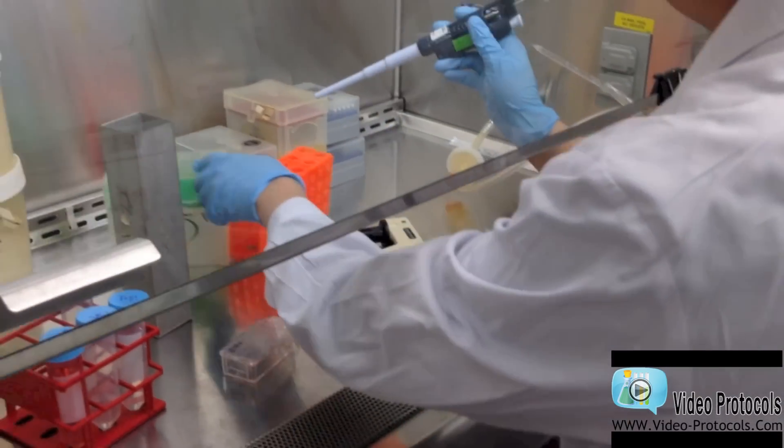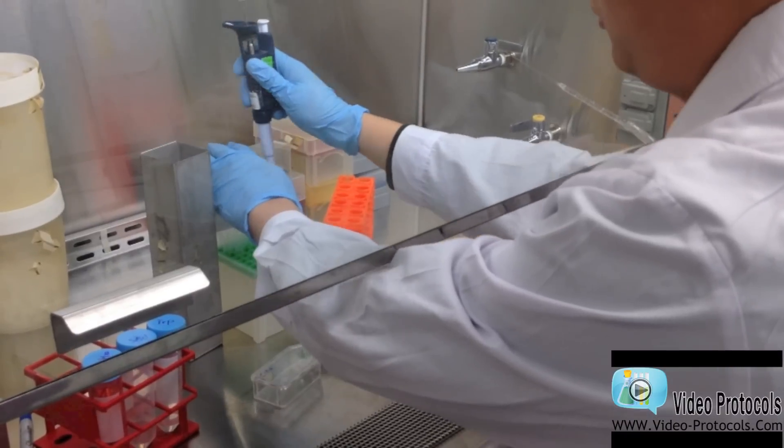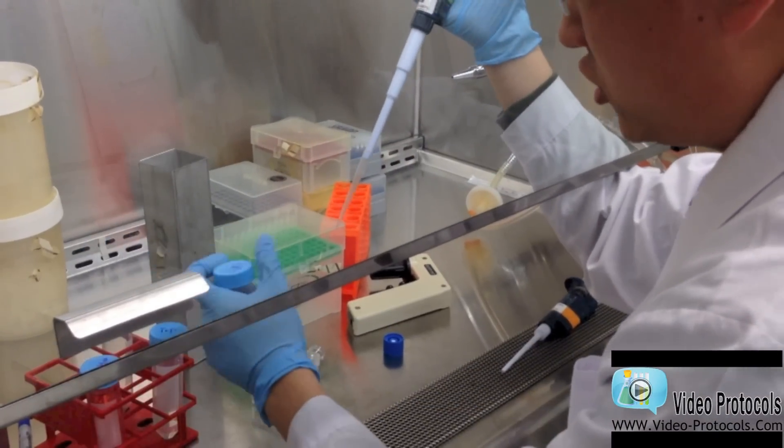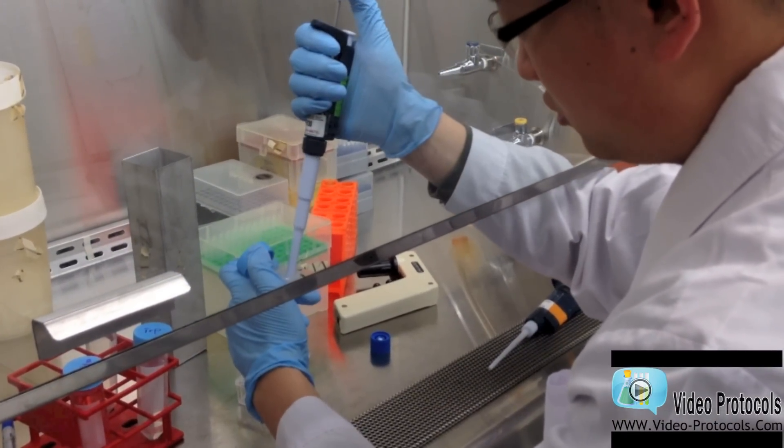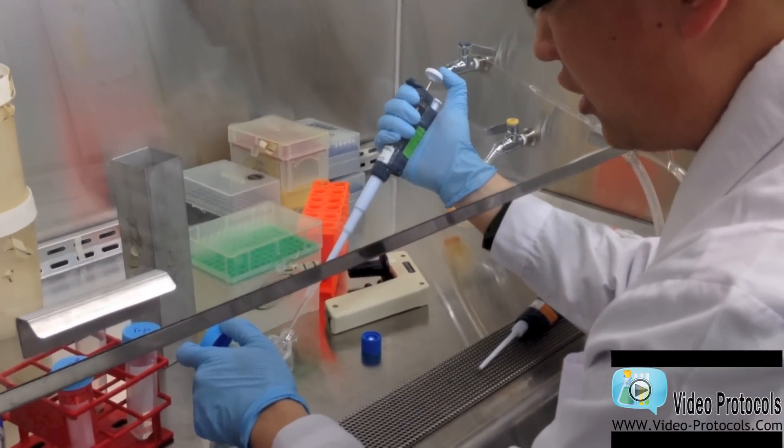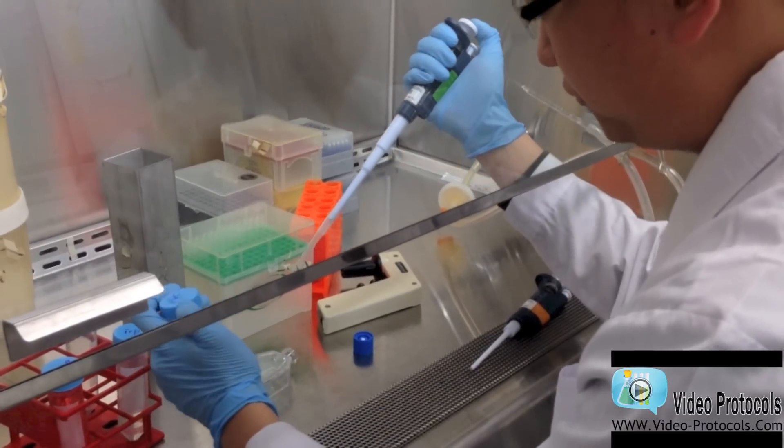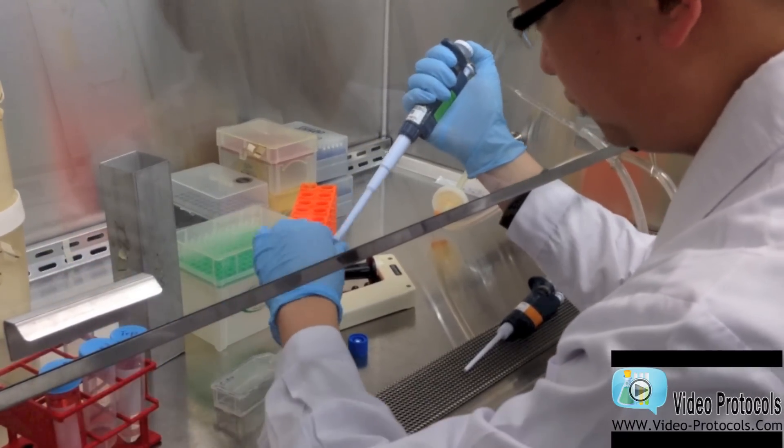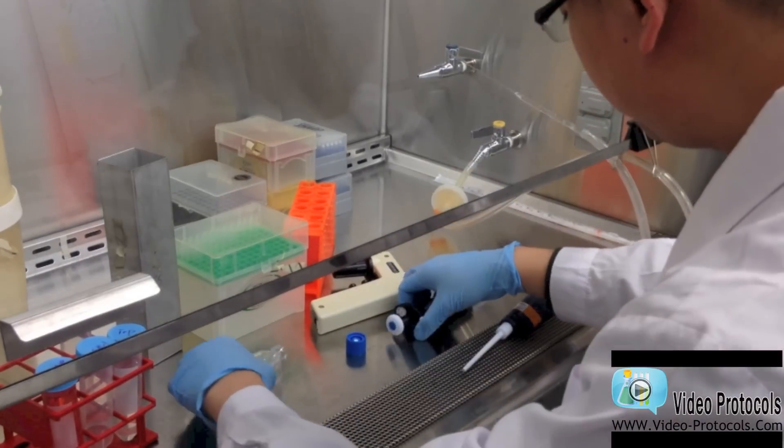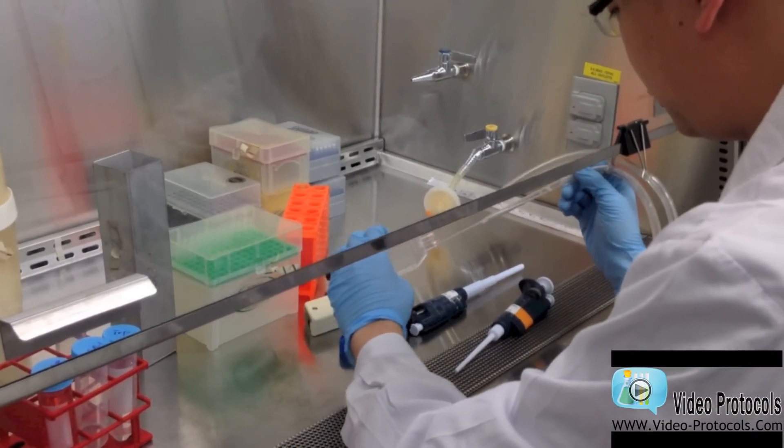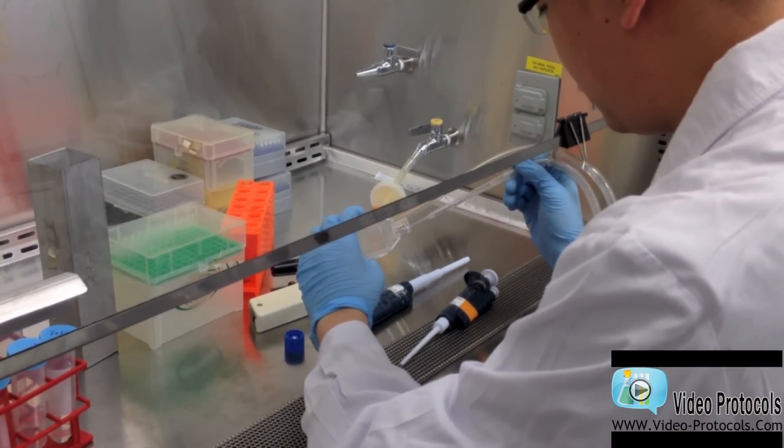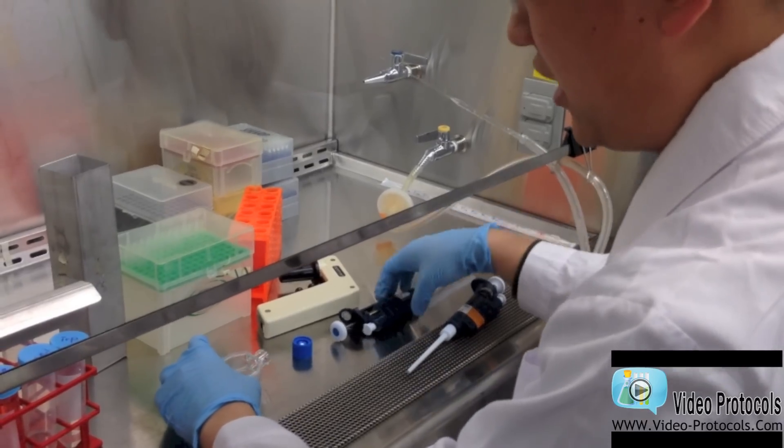Now very quickly, we will use PBS to rinse out the dead cells. We aspirate out the PBS.